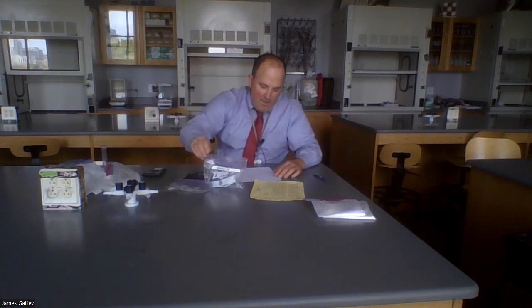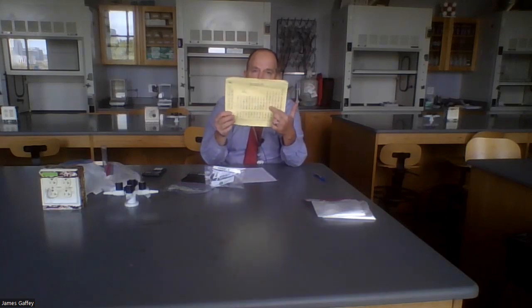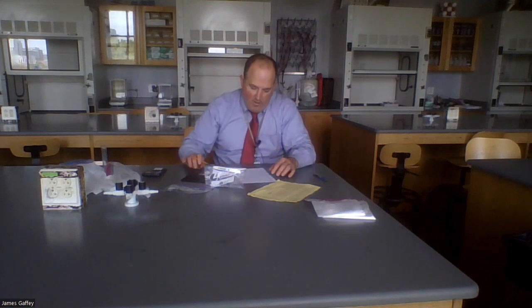It's down at 102.1. So if we were to answer the question, which sample is not 1 mole? It's sample A. What is the mass of 1 mole of lead? It should be 207.2 grams. I got that number from the periodic table. And how many atoms are in the larger sample? Well, Avogadro's number, 6.02 times 10 to the positive 23rd.